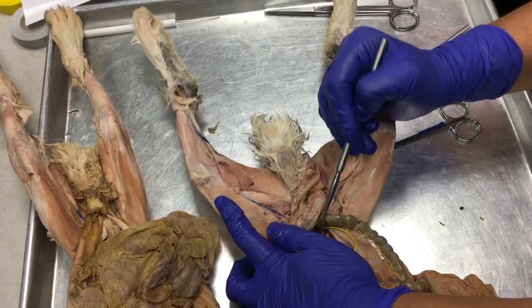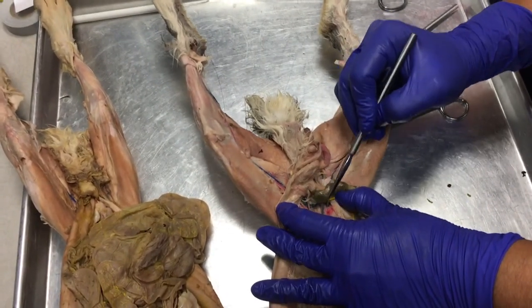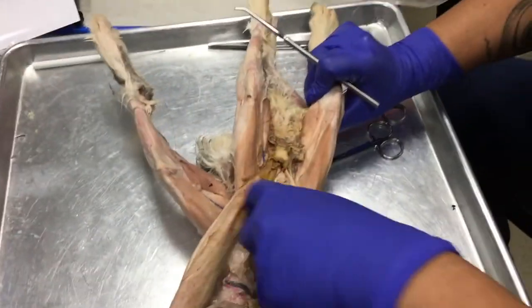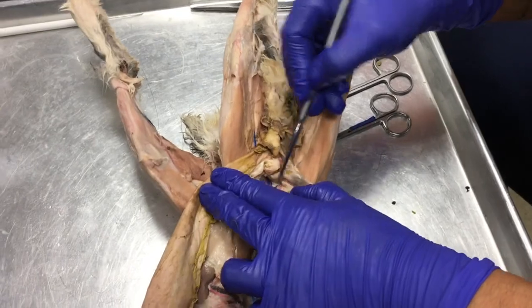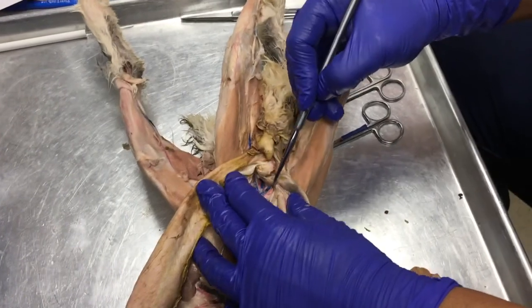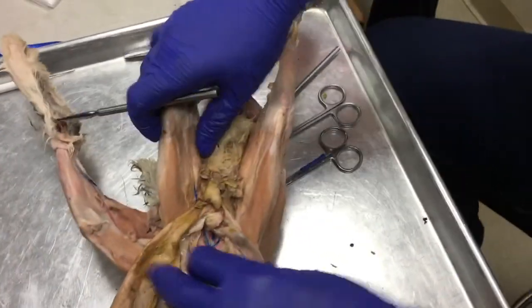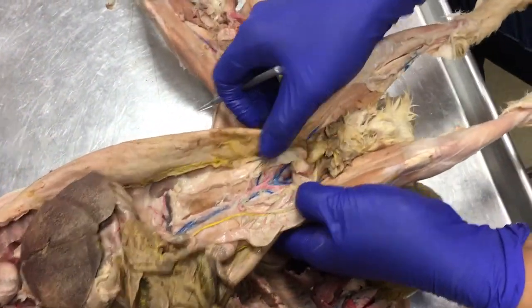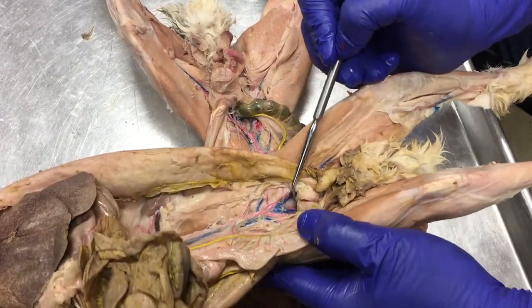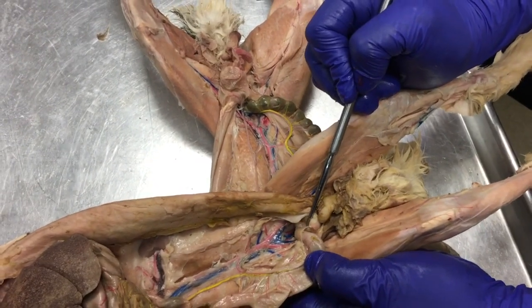Once it enters the abdominal cavity here, let's see about this one. Ooh, that's nice. Okay, so look at it. Once it enters the abdominal cavity, we have a V, just like with our external iliac arteries. We have common iliac veins. This is a really nice example. And if you look way in the center there, you can see both a caudal artery and a caudal vein, yellow or pink and blue.